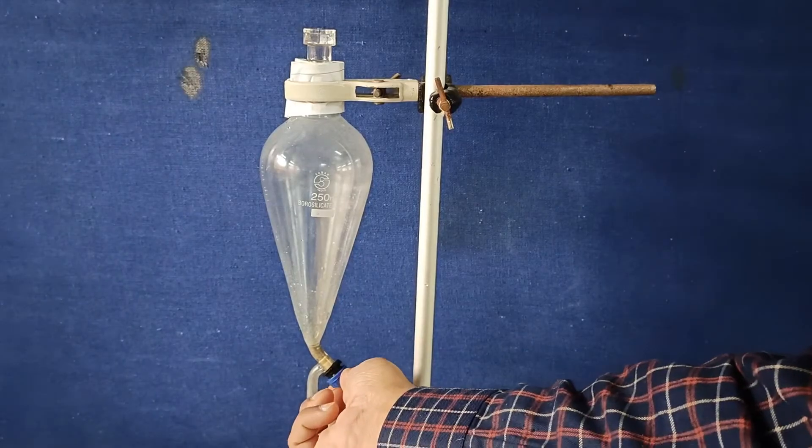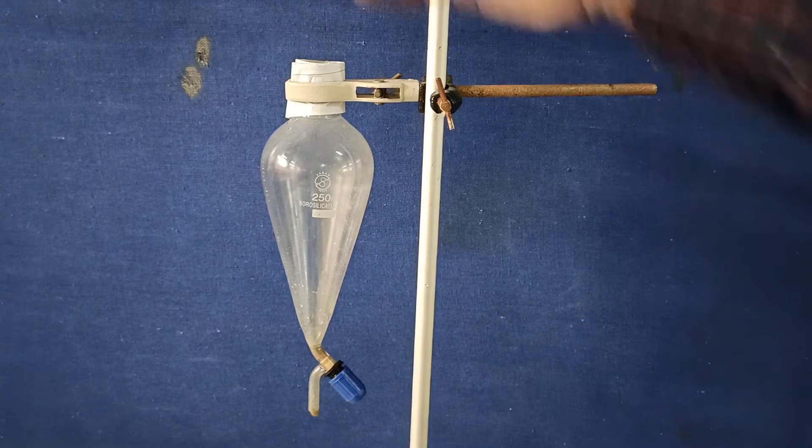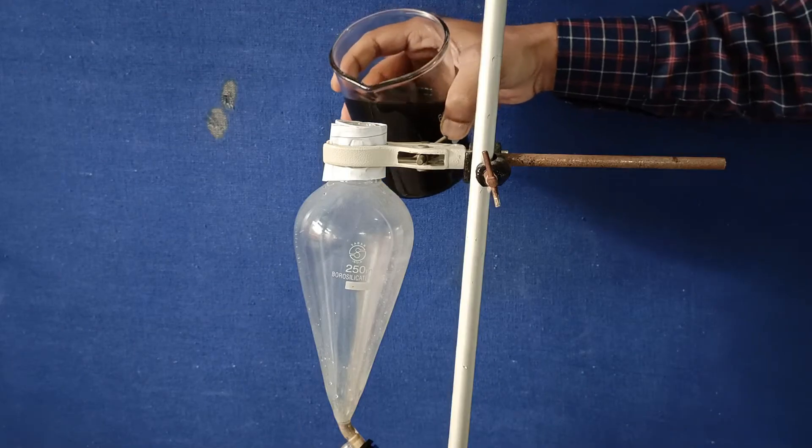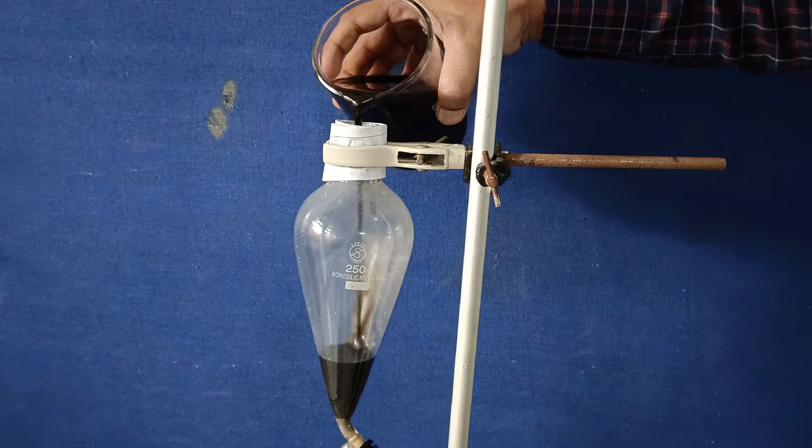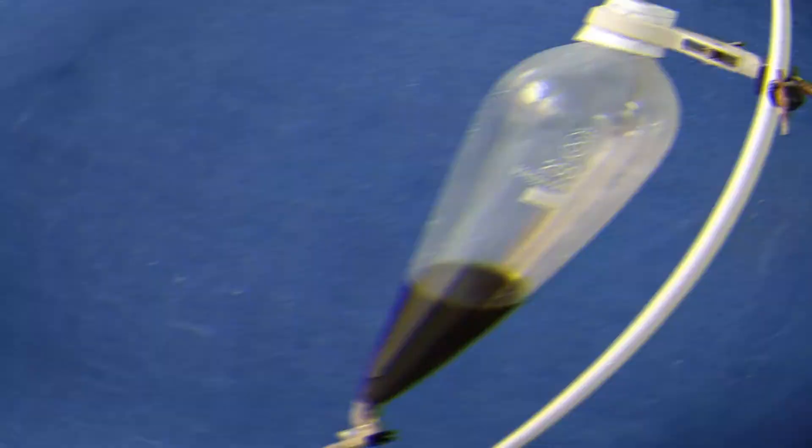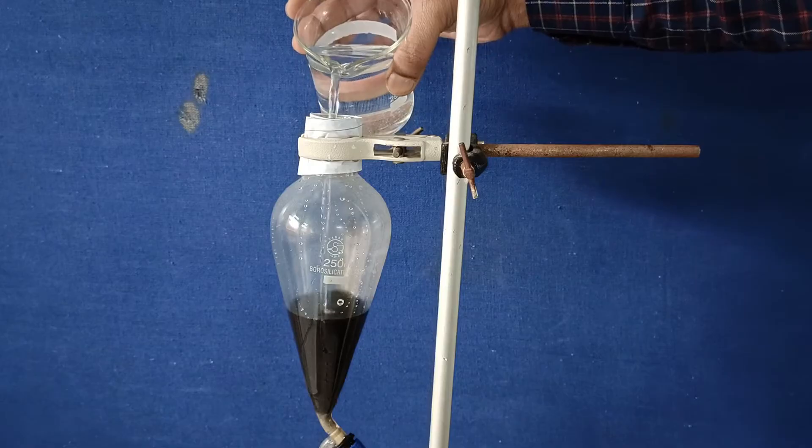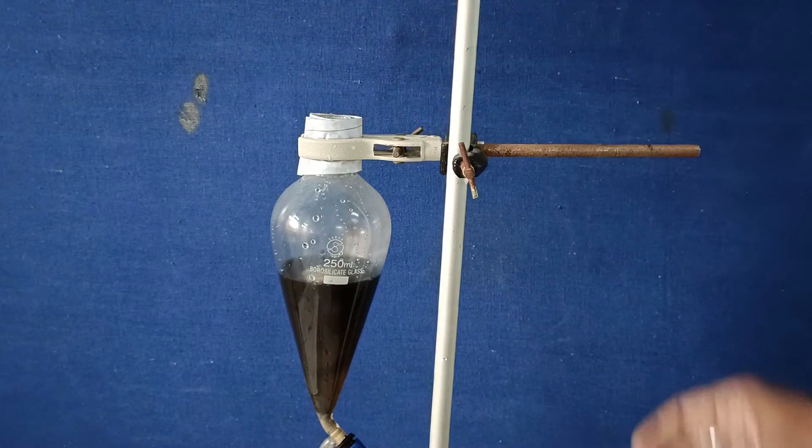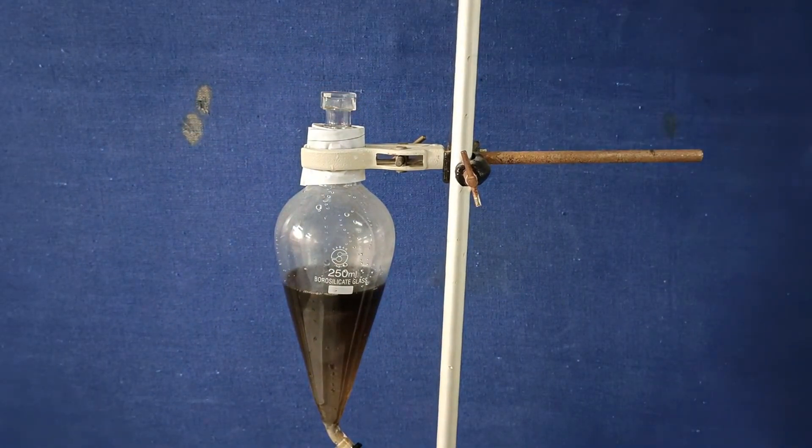Kindly make sure to tightly close the stopcock before starting the experiment. Open the knob and add the oil. Add the water afterwards. Now allow the mixture to settle for about 15 minutes.